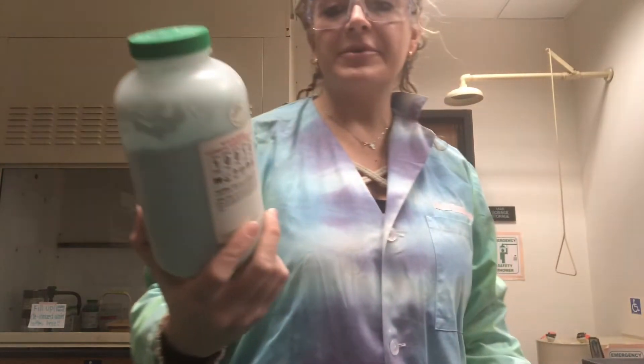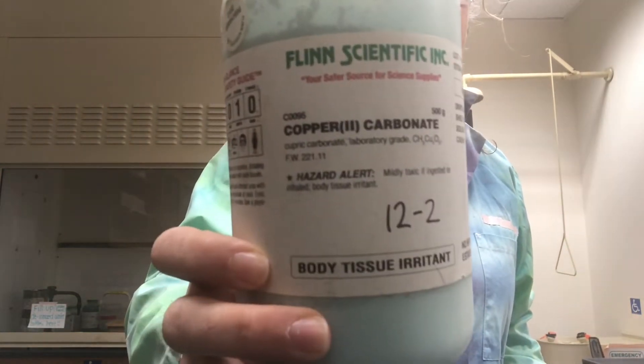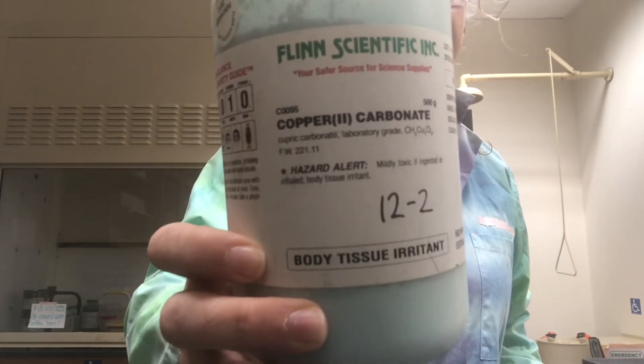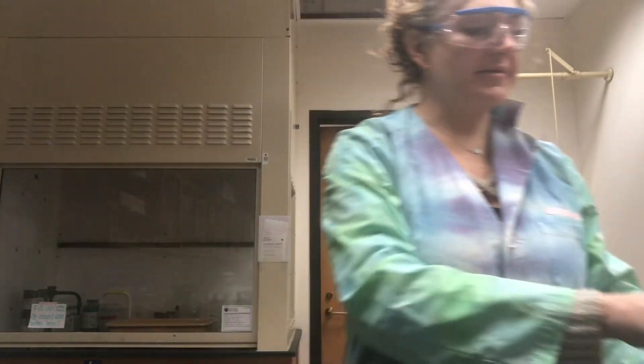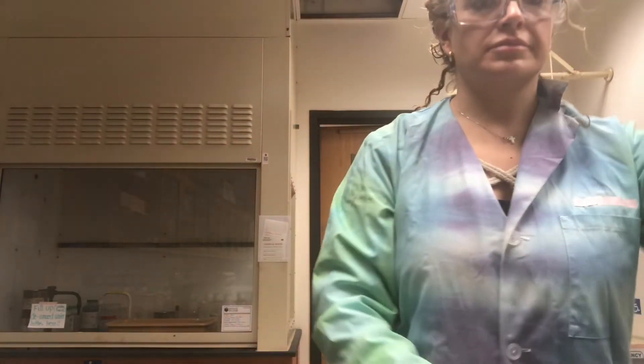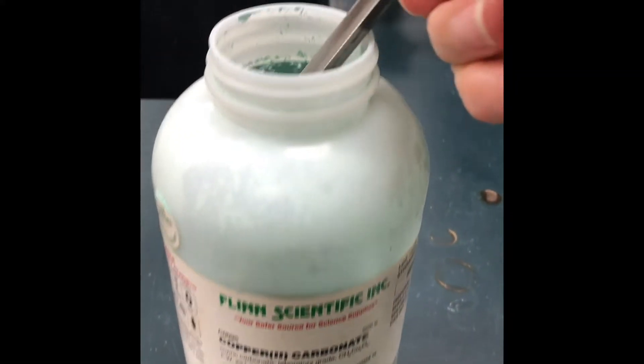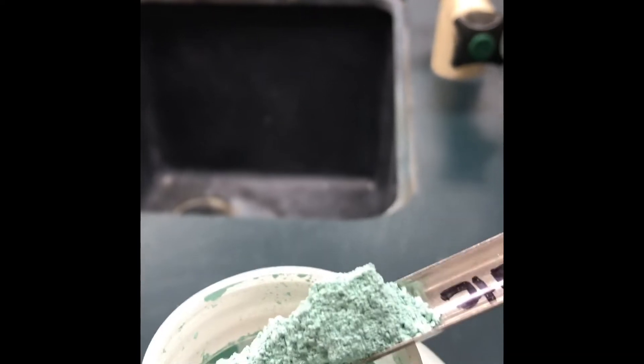For our next reaction I'm going to be using a compound called copper two carbonate. Give you a second to look there. Here's a scoopula of copper two carbonate. Go ahead and make some observations.